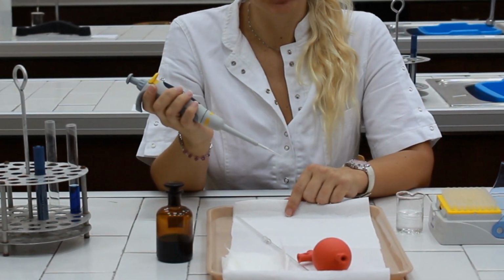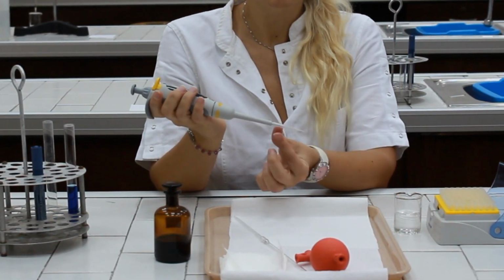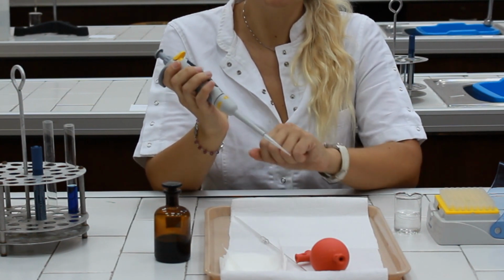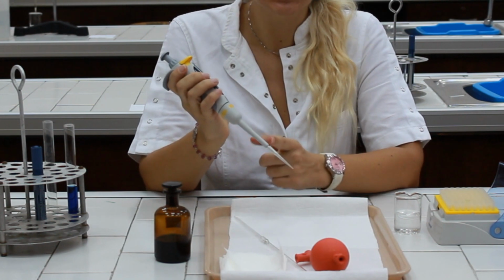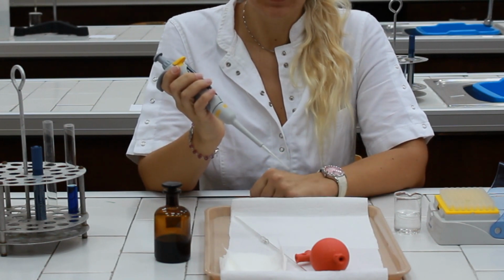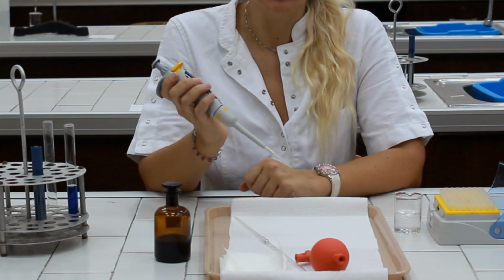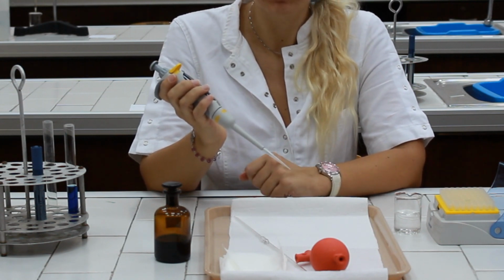In the second step, we need to pick up a tip from the tip box without applying too much pressure. Now, we have to use our fingers just to check whether the tip is attached firmly to the end of the pipette. If it's not attached firmly, it will not pick up the accurate volume of the liquid or the sample.